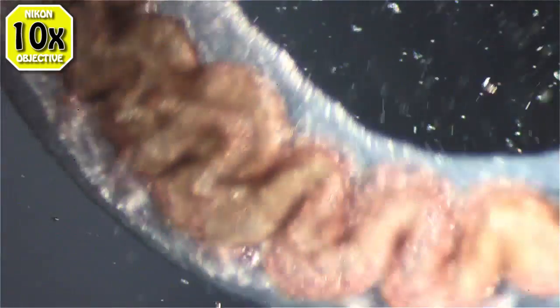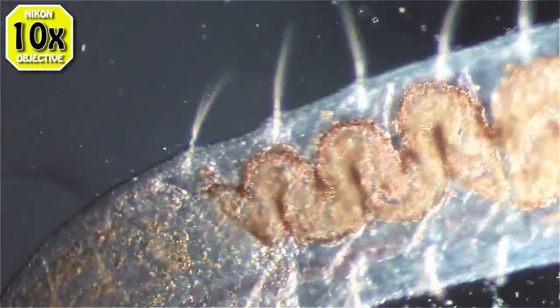And here I'm adding water under the coverslip. It seems to have been drying out a little bit. See it sucking in under the edge of the coverslip there. And he probably likes that. More oxygen to cool him down. See I still don't see any eyes in there though.